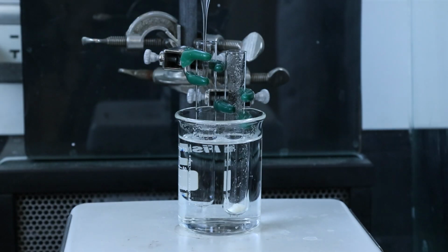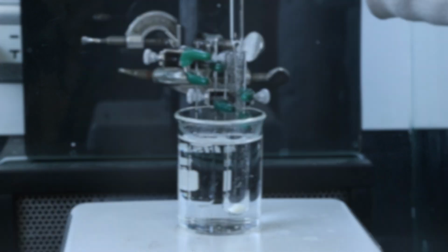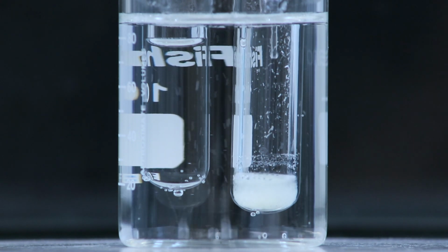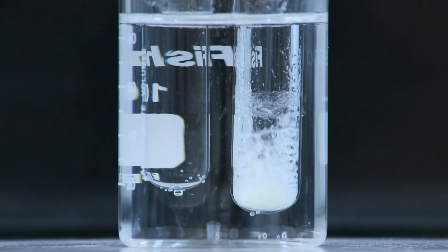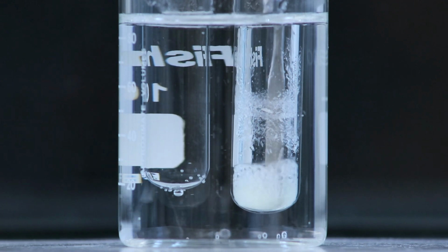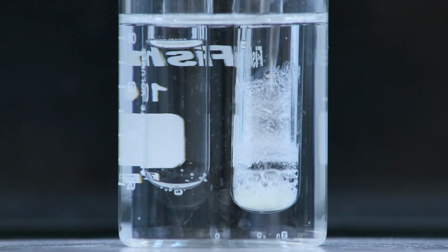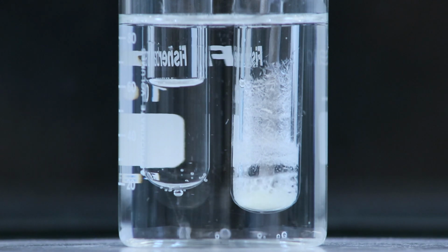Once the hot bath is ready, you can start slowly adding the solvent using a Pasteur pipette. This should be done slowly in order to not add an excessive amount of solvent where you would have problems getting the product to come out of solution even when you cooled it down. You should also stir the solution to help the product dissolve in a minimum amount of solvent, and you can do that by spinning the spatula in between your fingers. More solvent should be added until the product is completely dissolved in the solution.